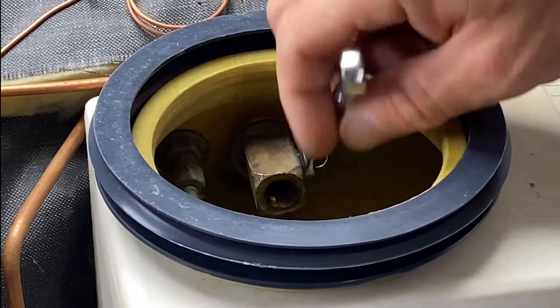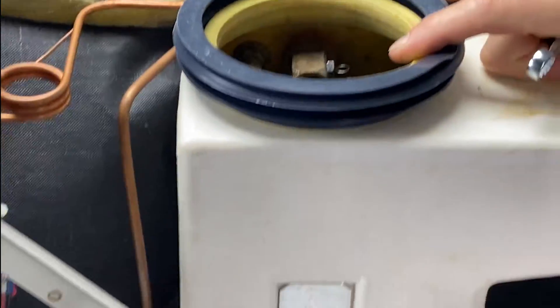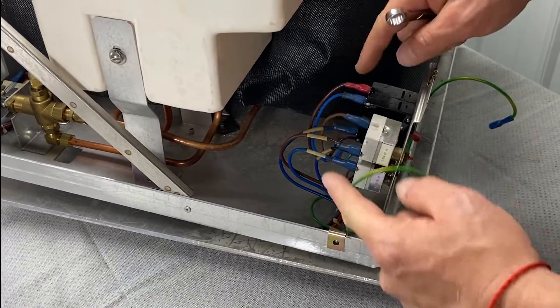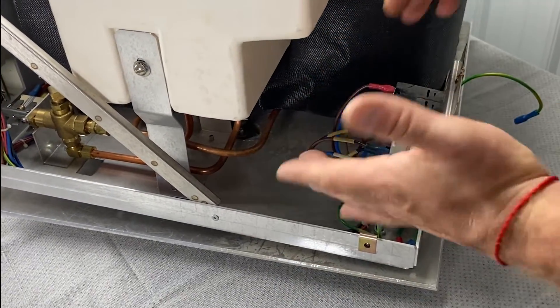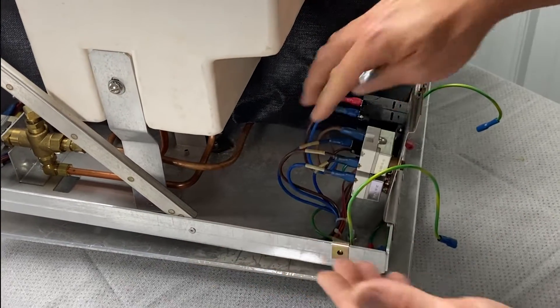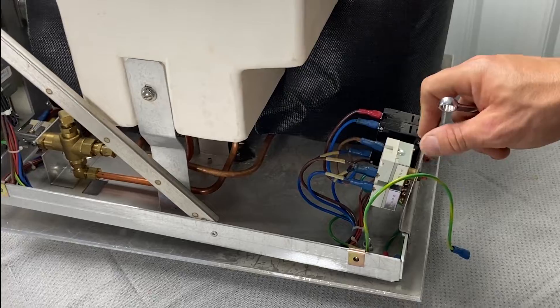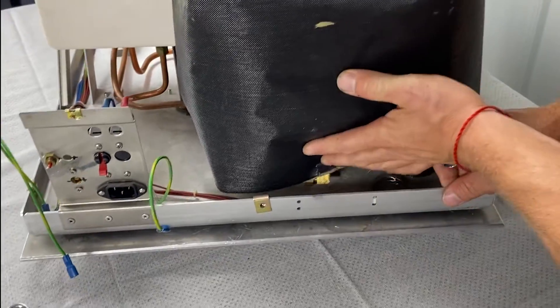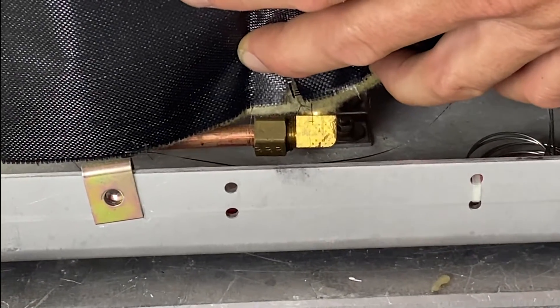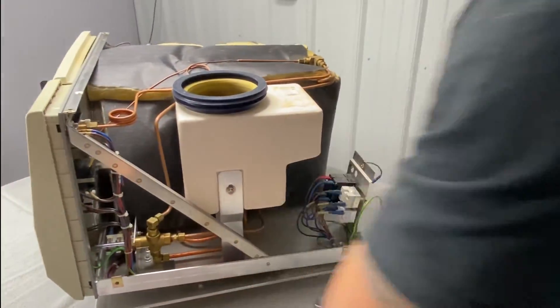This is another good opportunity while we have the cover off — go down here and inspect, just look around. This is where all your power source is. You want to look for burnt or browning wires, and while we have the cover off, attend to those. You also want to look for leaks. Usually you'll see leaks underneath the reservoir. With the cover off, take a peek at this fitting — it's at the back bottom of the chamber and it's a big leak spot for these units.